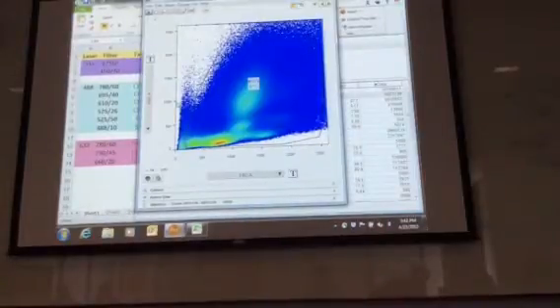Let me see your compensating. It froze already. You may need to reinstall. When I compensate like this, is this too large of an area? Should I make it come in here and then come back out? No, that's fine.